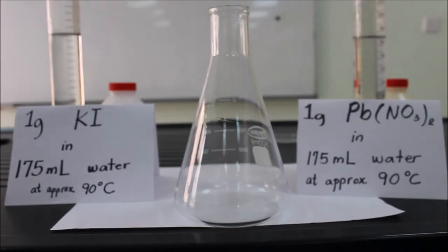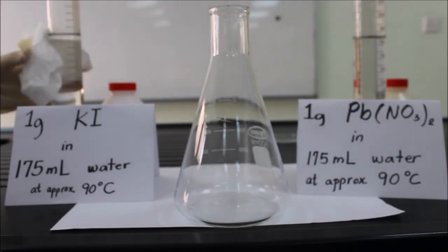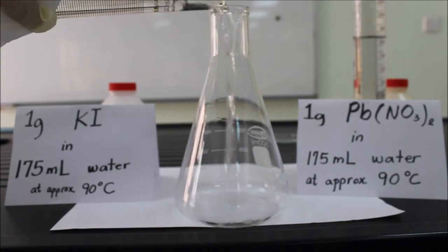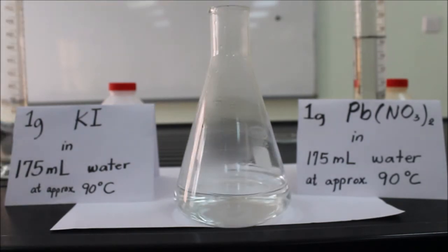So I will now put the potassium iodide solution in the flask. And now, the lead nitrate.